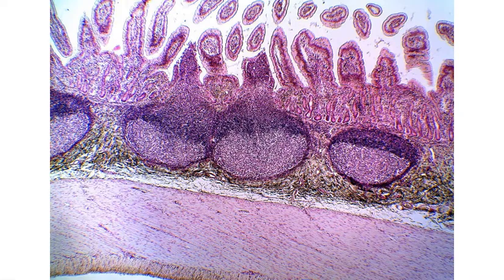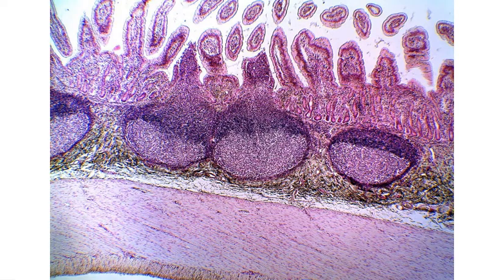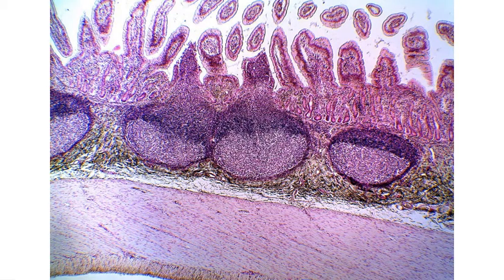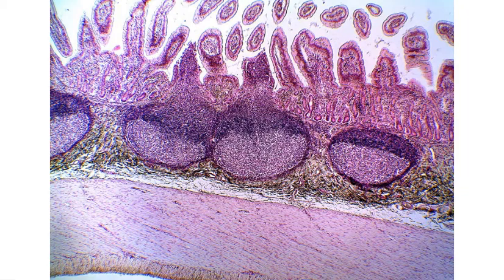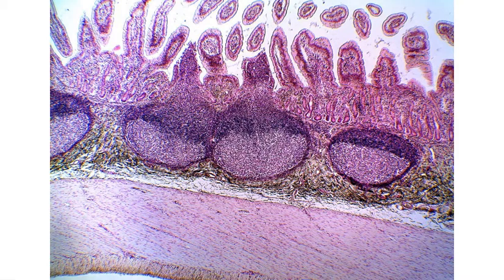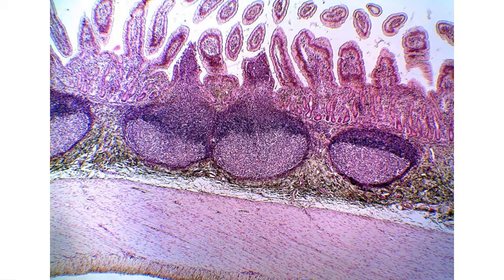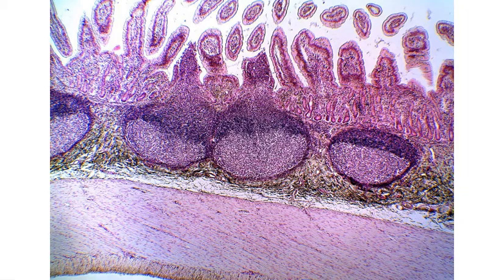This slide is from the ileum. The current magnification is 40x total magnification. What we're looking for are going to be the four tunics or layers of the GI tract, and any specialized features of this region of the small intestines.